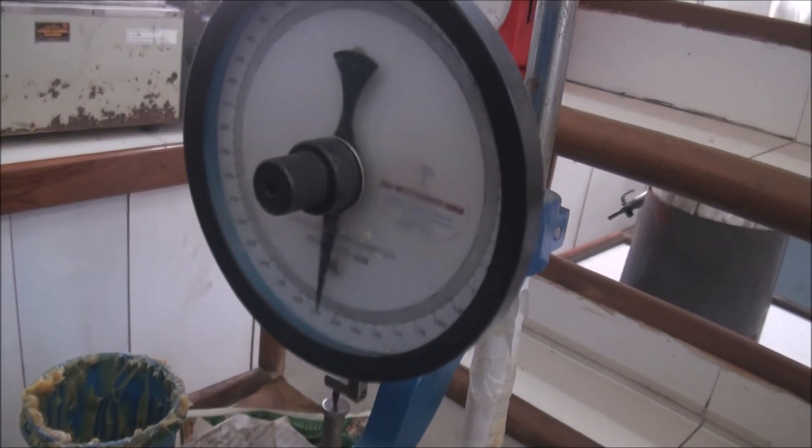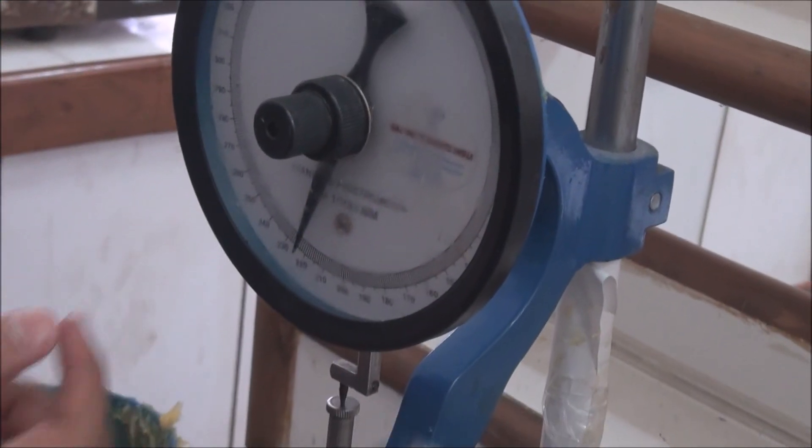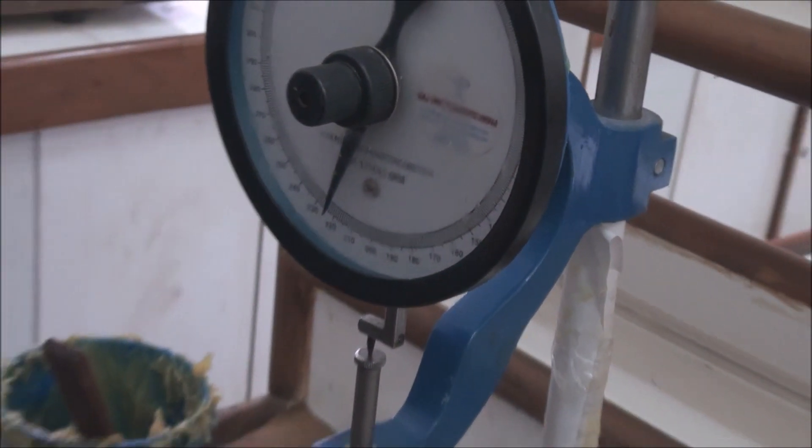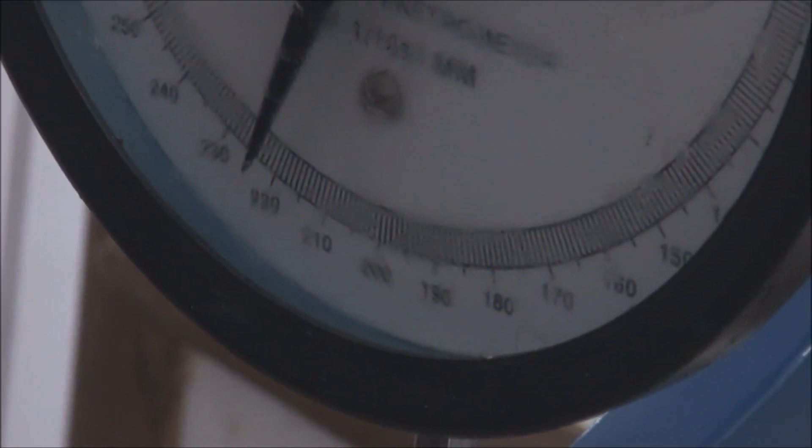Now note the reading in the dial. Repeat the experiment for the same grease after cleaning the apparatus and again notice the reading. If the reading remains almost similar to the previous ones, we can conclude that the grease is consistent.